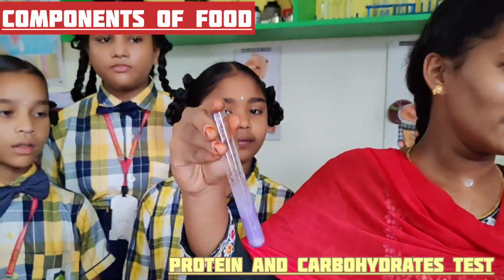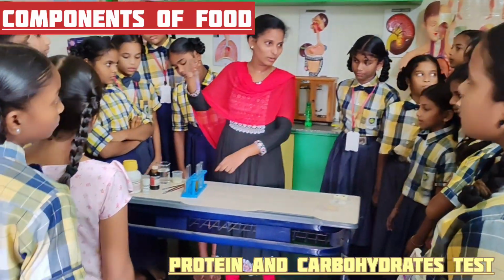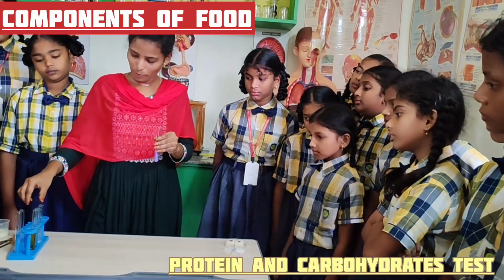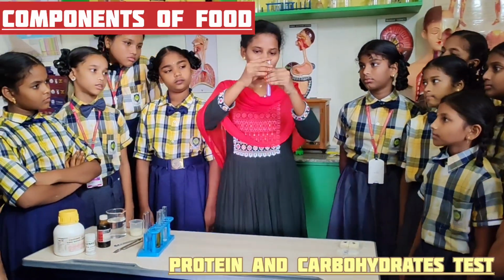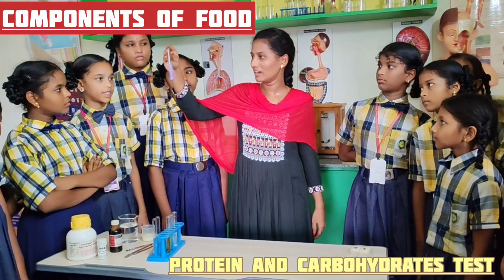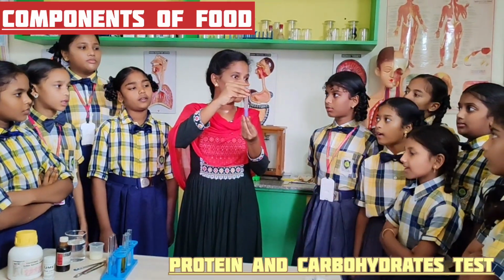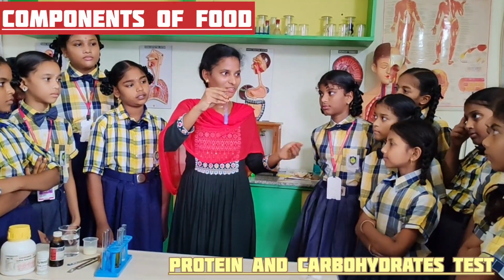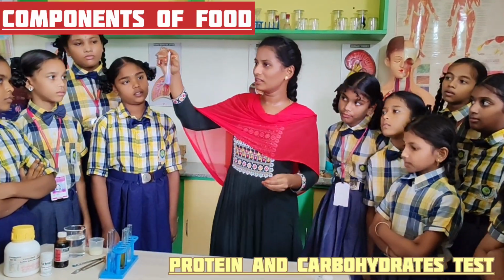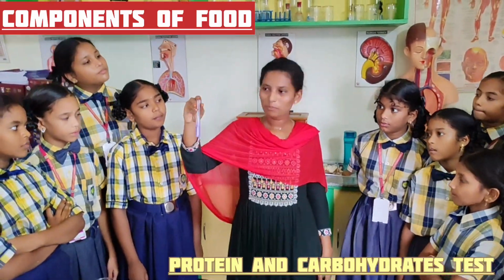I already said yesterday, the protein test is conducted by using copper sulfate solution and sodium hydroxide solution, and we add 2 drops of copper sulfate and 10 drops of sodium hydroxide into milk. It is converted into purple or pale violet. Okay? So milk is rich in protein. Calcium is the mineral. We have to do another test for mineral detection. It is protein. So we come to know milk is rich in protein.